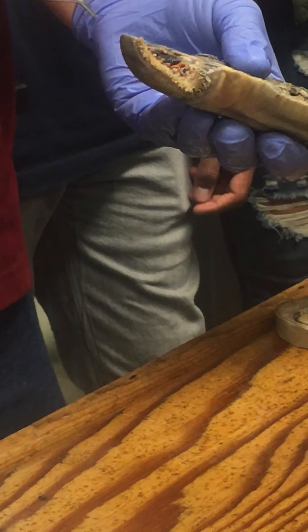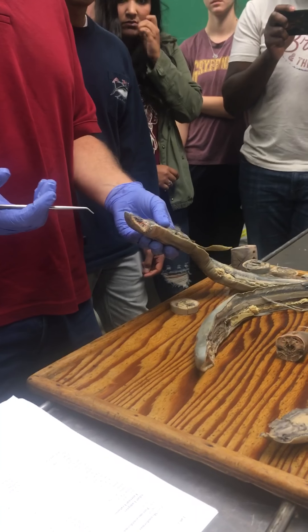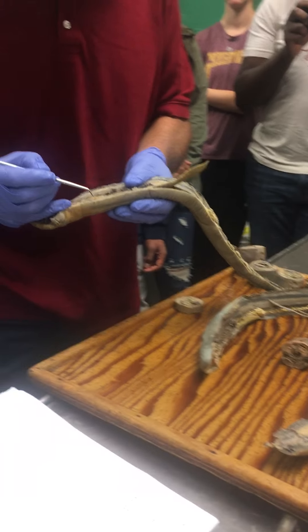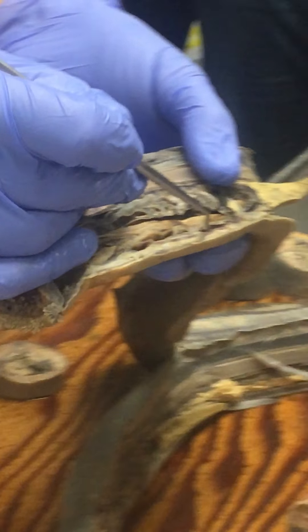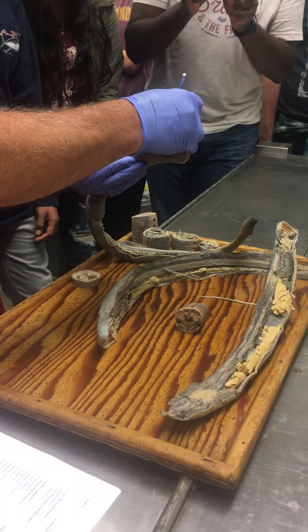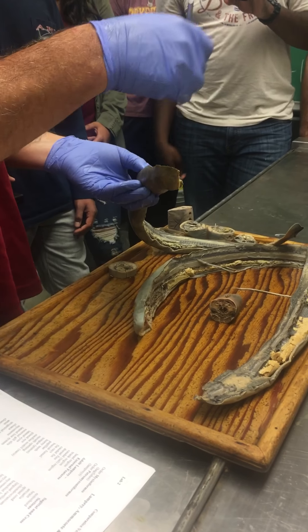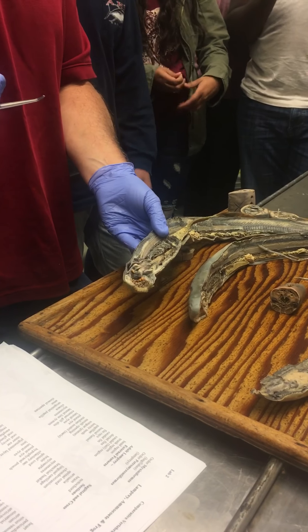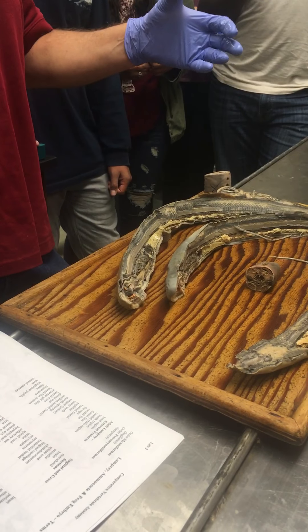The branchial basket are the cartilages that surround the gills — the root 'branchi' means gill. In the sagittal sections you'll see little reddish, harder structures running along under the gill region; that's all part of the branchial basket. What it does is give the muscles of the branchial region something to work against — they squeeze down, squish the water out, and the elastic cartilage pops back out and sucks water in.